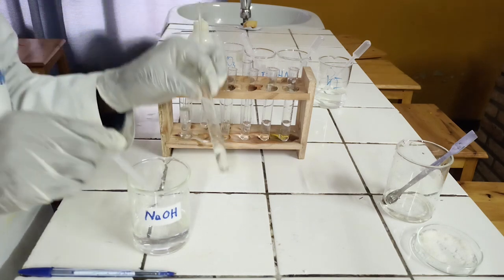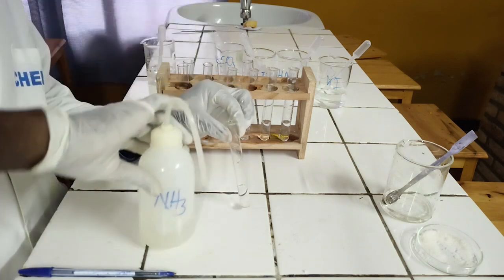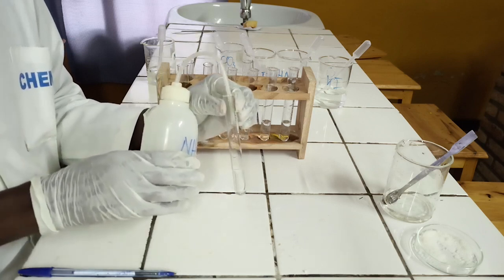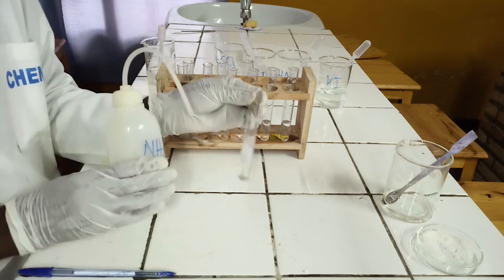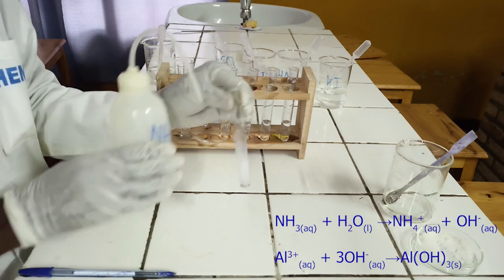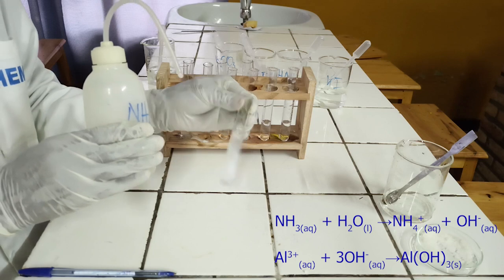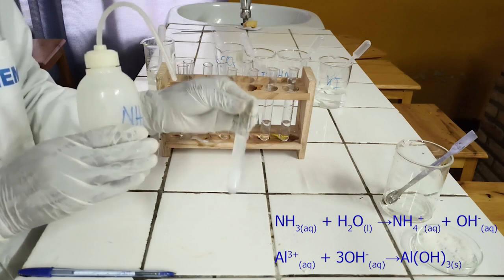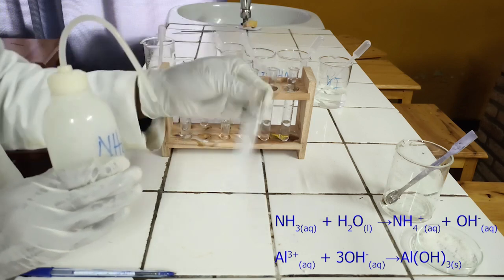To the second test tube, add ammonia solution dropwise until in excess. As you see, ammonia solution reacts with aluminium ion to form white precipitate, which is insoluble in excess of ammonia. Below, there is an ionic equation for this reaction.